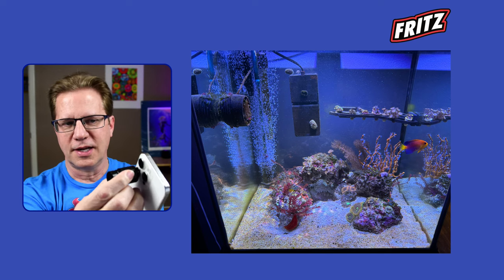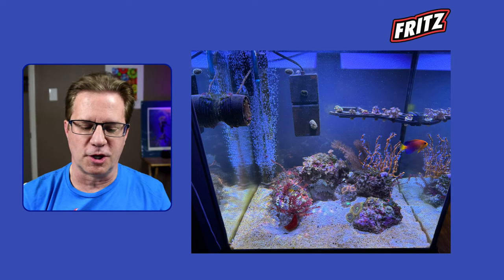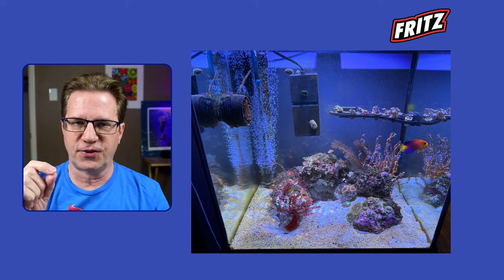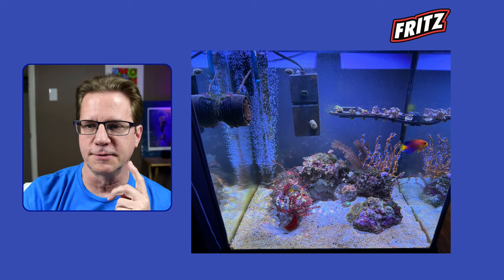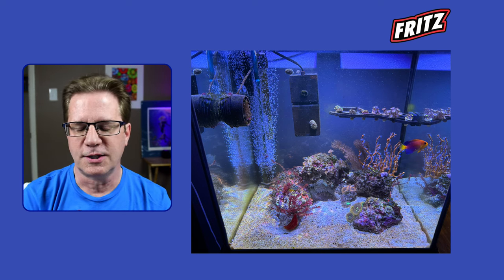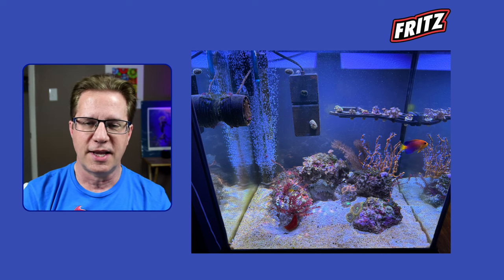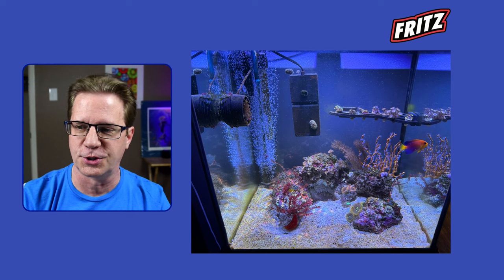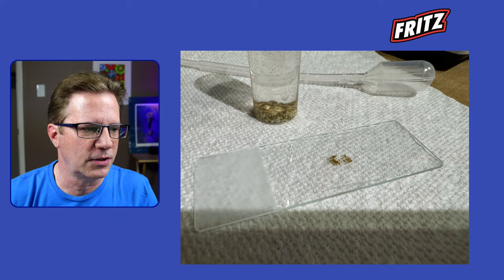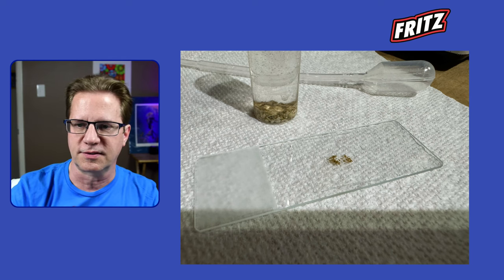Sometimes I would have to disable the macro feature so it would turn that camera off and the phone would try to play nice as I tried to film what was going on on the actual slide. It is possible but it's kind of a balancing act. If you can use two hands, great — if you're trying to hold the phone in place and adjust the focus, I'd just get the focus right before you do anything.